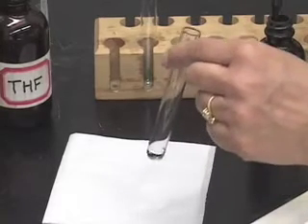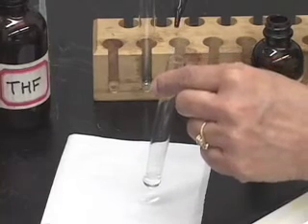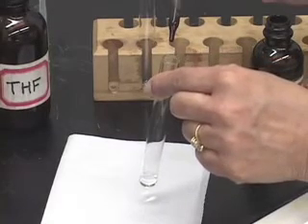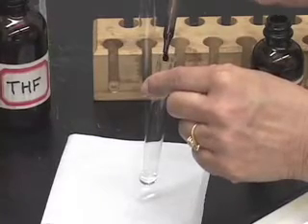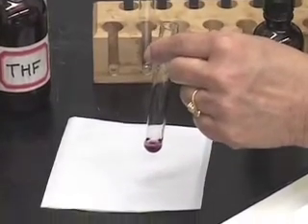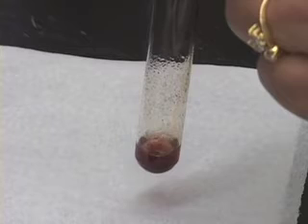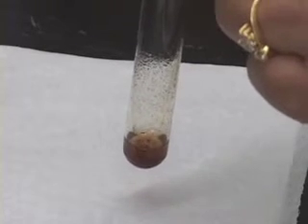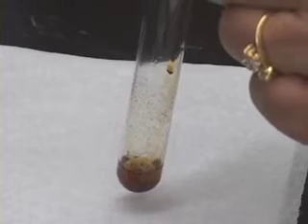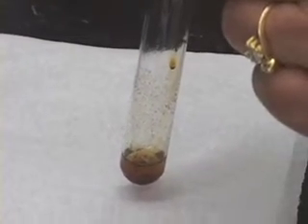I am going to slowly add potassium permanganate one drop at a time. Add a drop, mix the solution, and see what happened. The solution is brown in color and you can see the brown precipitate settling at the bottom.